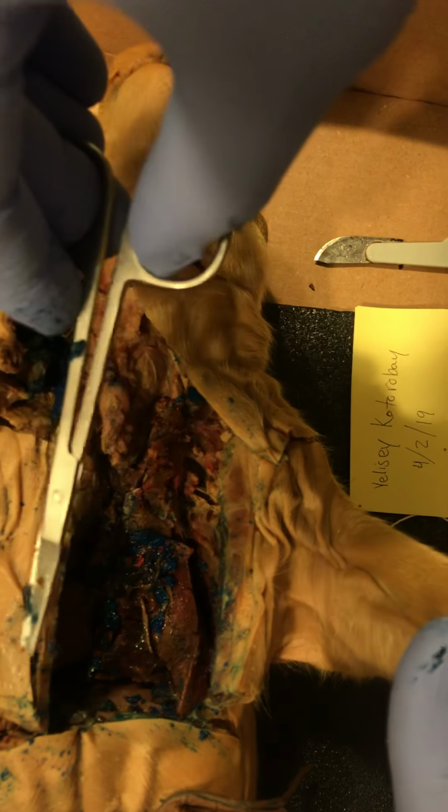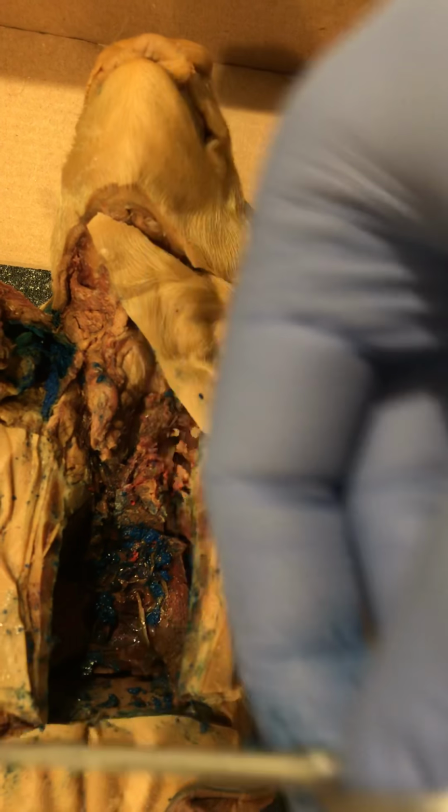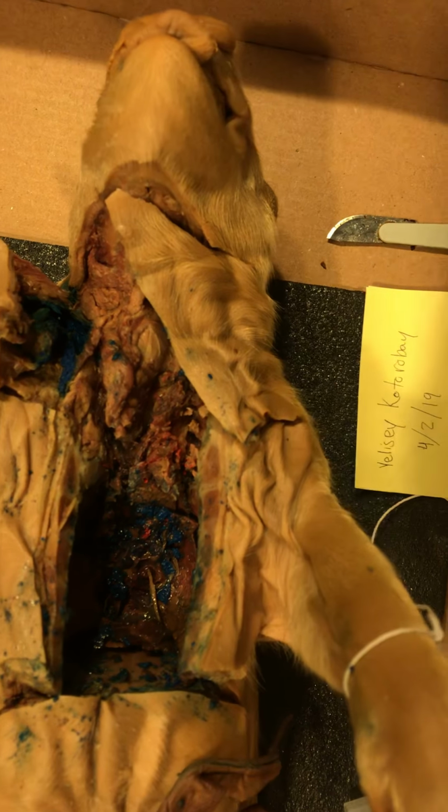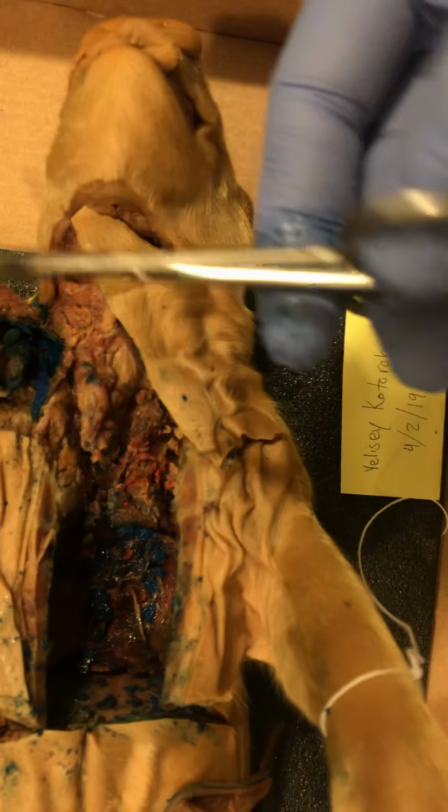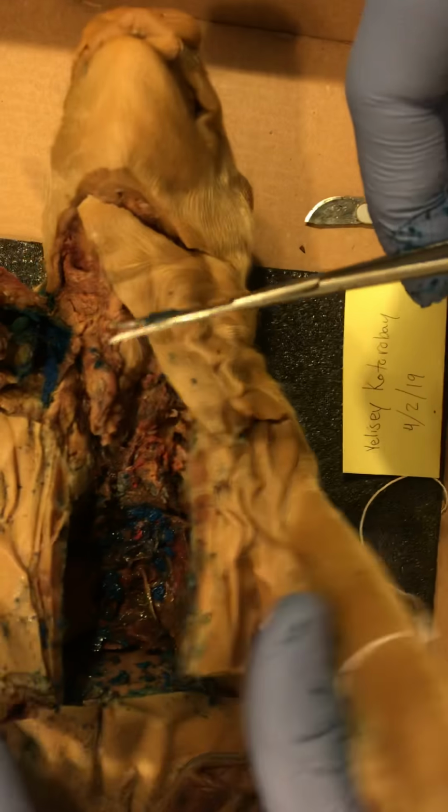This thin plate of muscle, this band of muscle running horizontally across, basically serves to divide the thoracic and the abdominal cavities, and it serves in the respiratory system. Whenever it contracts, it basically allows the lungs to expand because of negative pressure internally. You'll notice that everything else here, these little guys, are lungs.